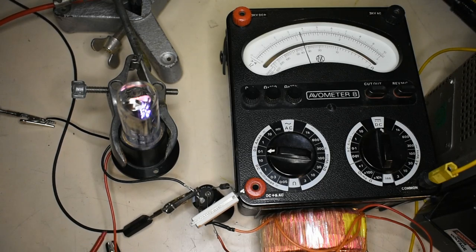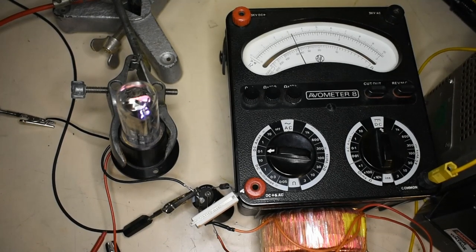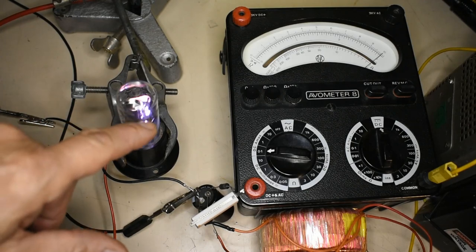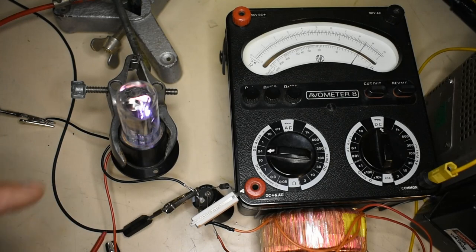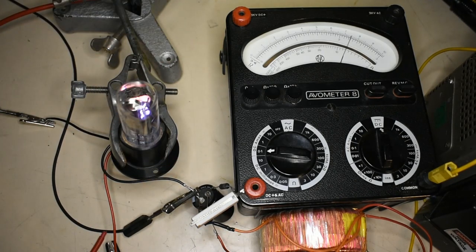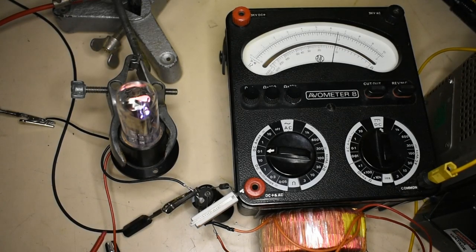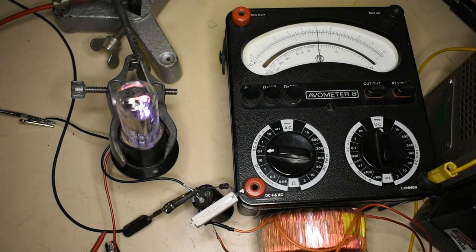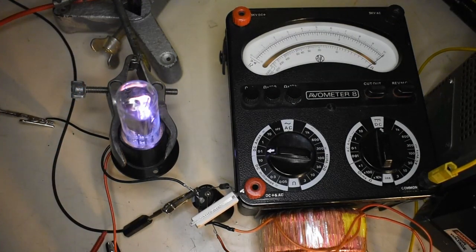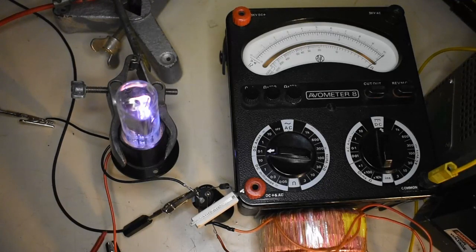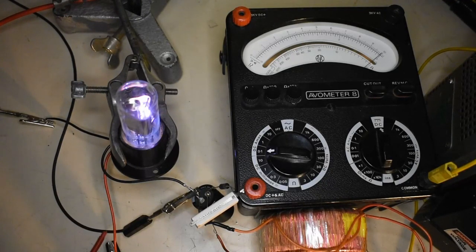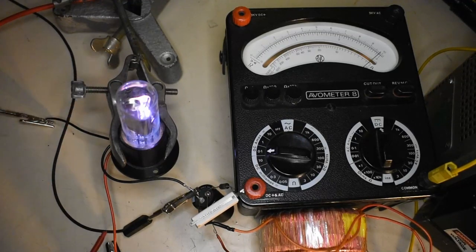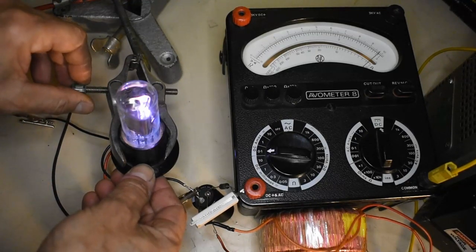There we go. The minute it triggers you can then bring up the current here and you can see the discharge is actually glowing inside the lamp. Once the discharge is established you can actually reduce the heater voltage to some extent; the current will keep that running hot.